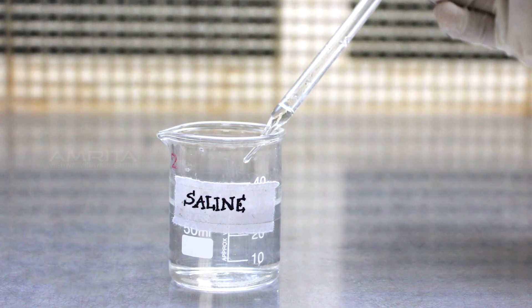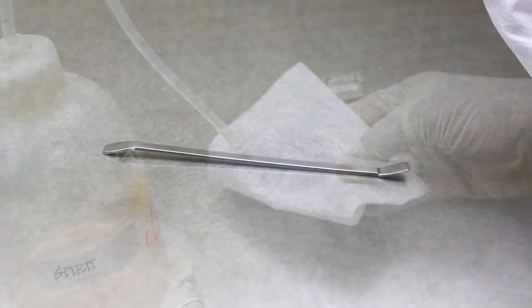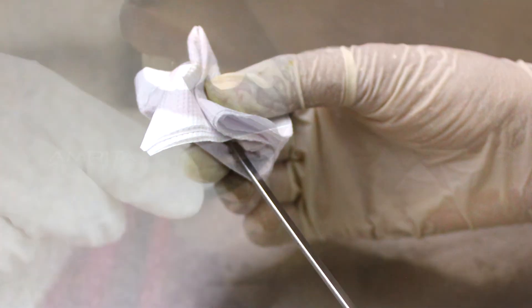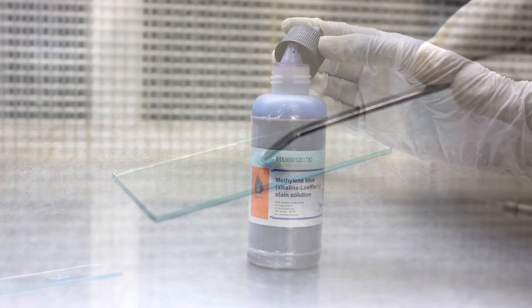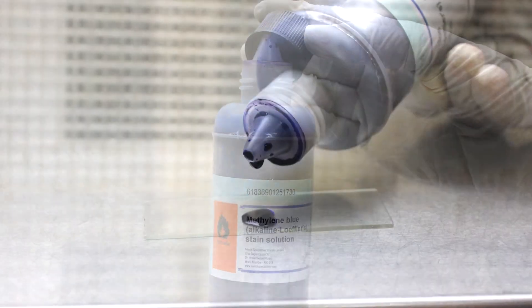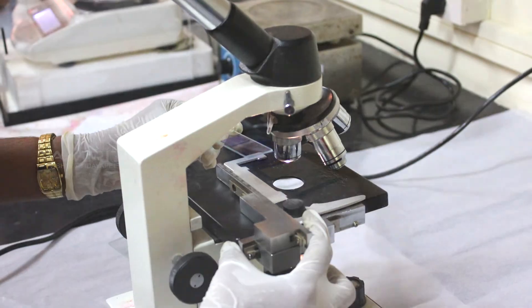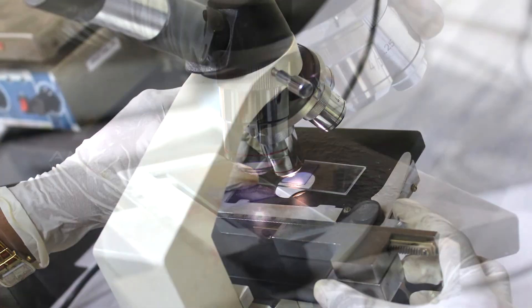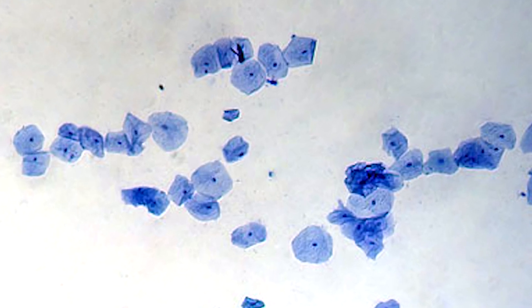The procedure begins by adding one drop of saline water on the centre of the slide. To take the cheek cell, first sterilise the buccal mucosal cell scraper with tissue paper using spirit. Then take out cheek cells and mix with saline water on the slide. Add one drop of methylene blue on the cheek cell and place the cover slip over the cheek cell. Place the slide on the stage of the microscope and observe at 4x, 10x, and 40x. The cheek epithelial cells can be clearly viewed through the microscope.